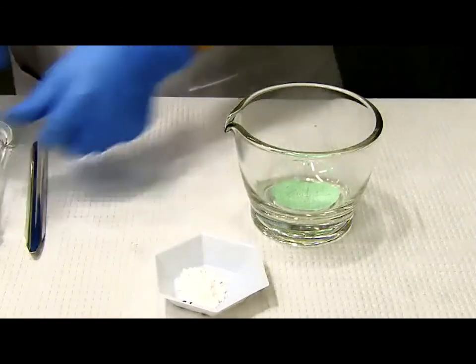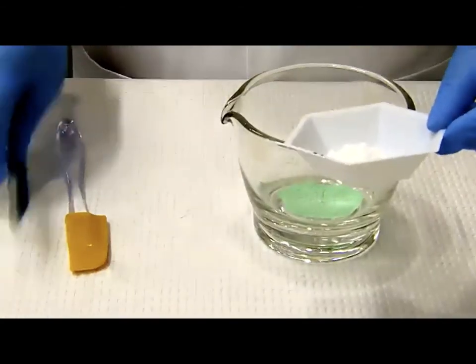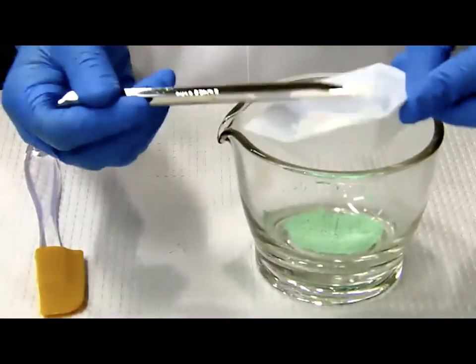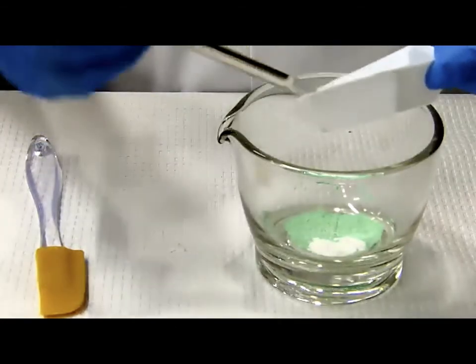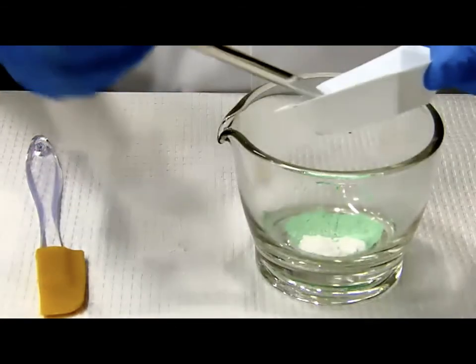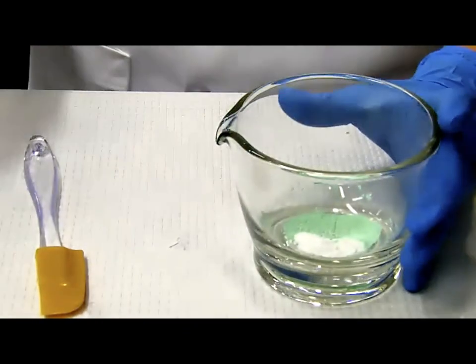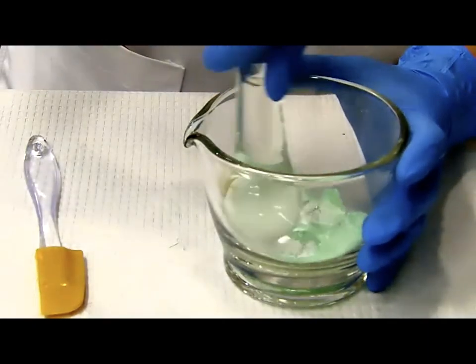Okay, so that's good. The color looks uniform now. I know that I have more lactose here compared to the amount of indomethacin powder. So what I want to do is add lactose twice using 2 additions. So that's about the first addition. And you see the very clear color difference because we added the food color.